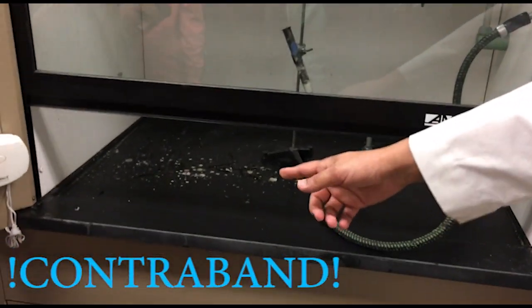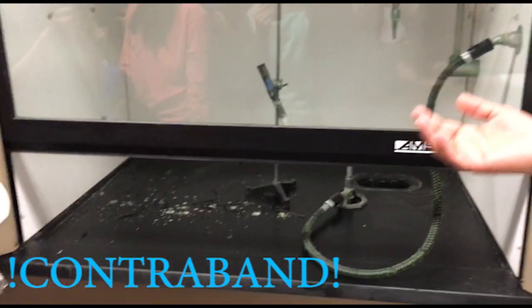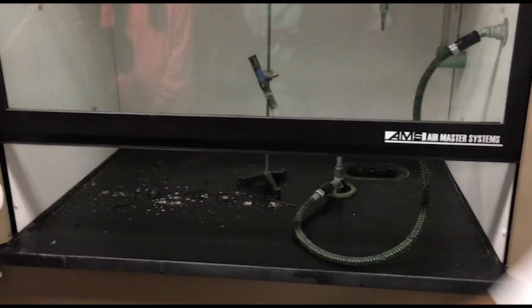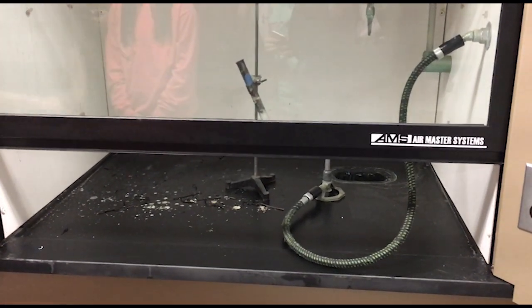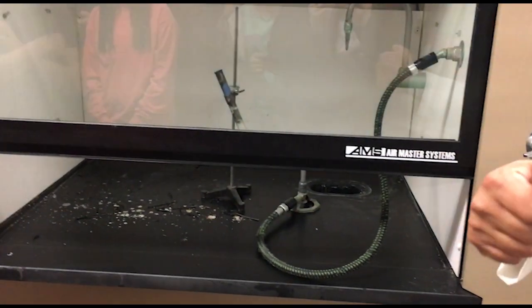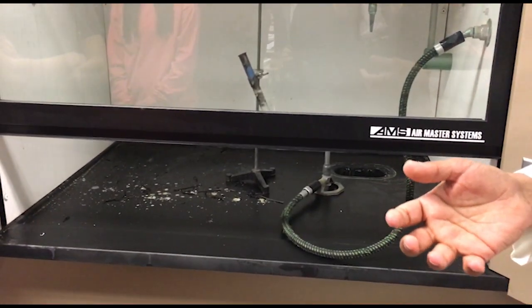And notice that we have quite a bit of residue. There's actually quite a bit of salt that's been produced from the reaction, and it was basically splattered out onto the surface of the fume hood there. So let me turn the fume hood on, and that is the decomposition of a metallic chlorate. And you saw what happened when all that oxygen gas was liberated. We had quite a big fire.